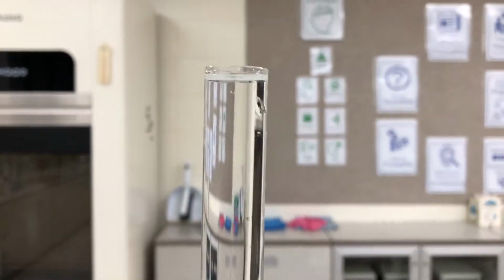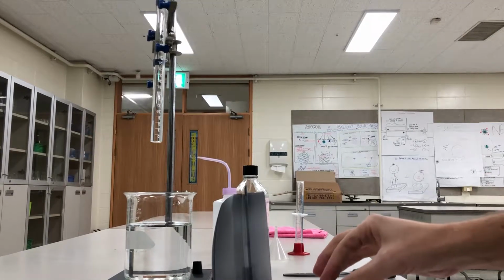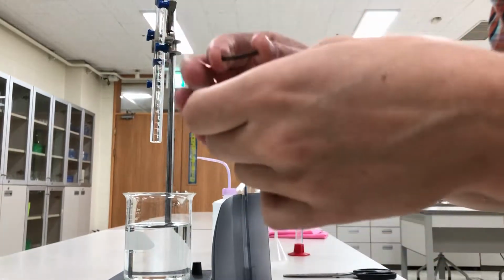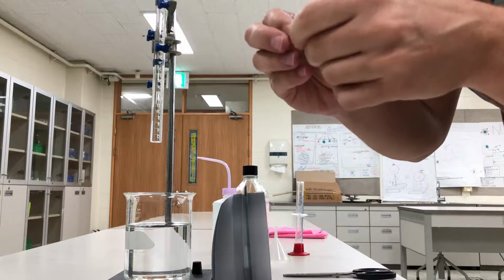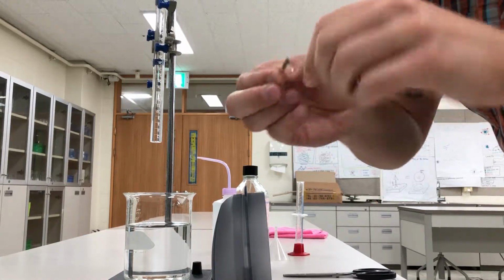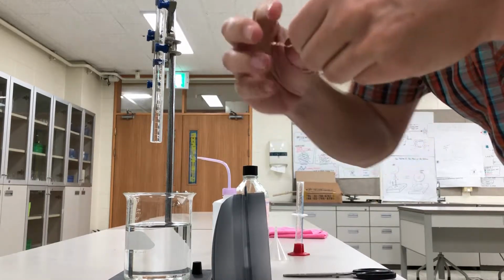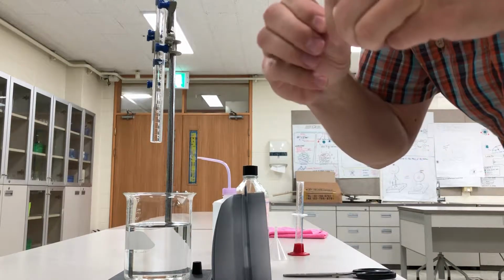So if you can see, I've almost filled it up, and what I'm going to do is I'm going to take the magnesium metal here and I'm going to wrap it in a cage of copper. And the reason I'm going to wrap this up is because the acid is going to react with the magnesium, and we want to keep the magnesium at the bottom. So let me wrap this up. Okay, and then I'll show you what it looks like. Okay, so there's that. And one more down here for good measure.